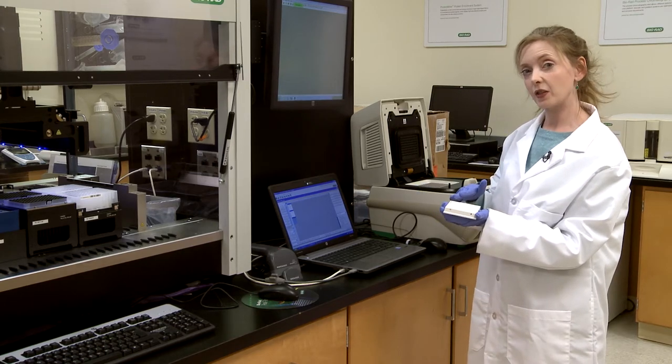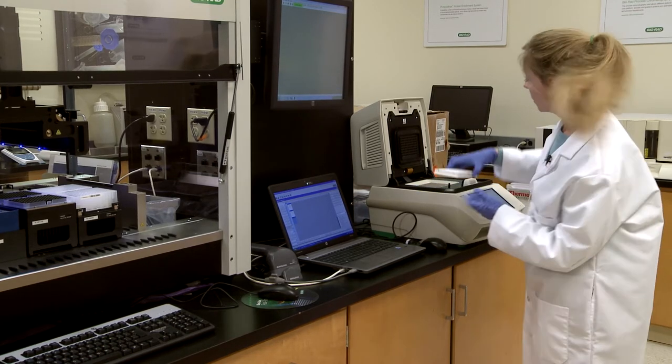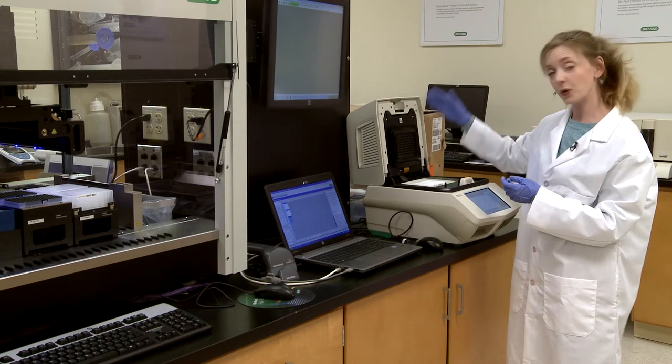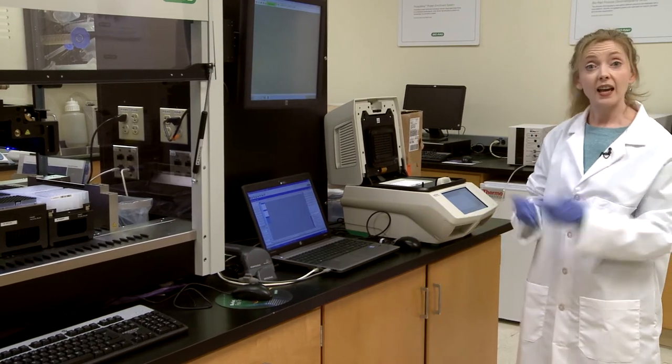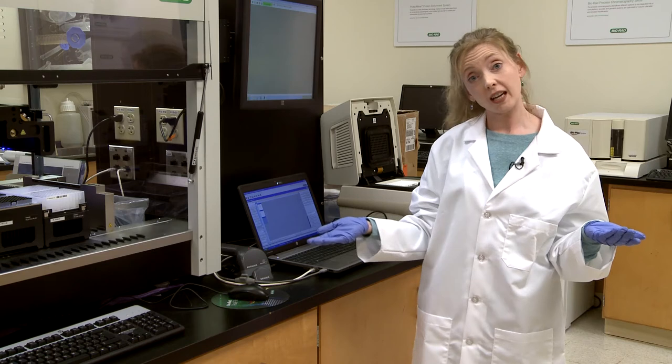You can use the Biorad plate sealer at this point or optical caps. Pop it into the machine. You're going to close the lid and hit run. And that's it. You get your results positive or negative.